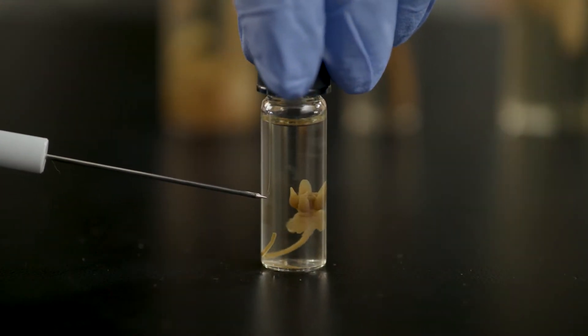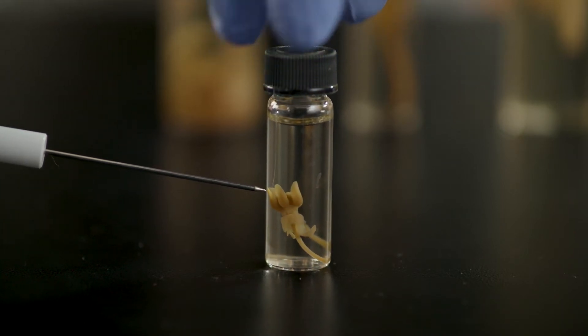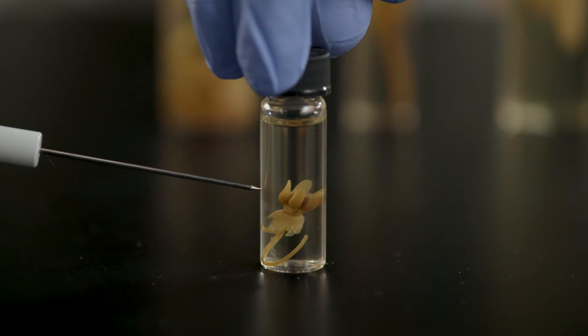Note that this flower contains bracts or modified leaves that resemble petals. These structures at the base of the flower are not true petals, so be careful to exclude them from your petal count.